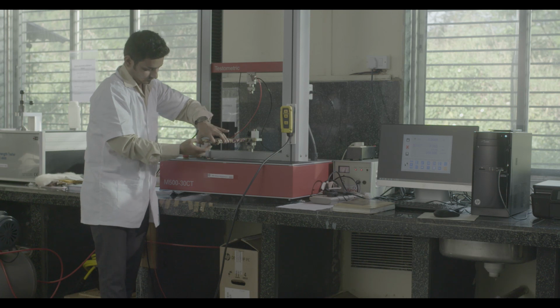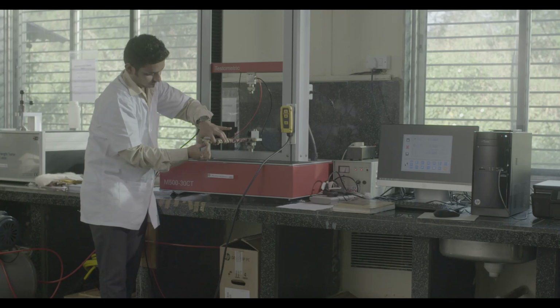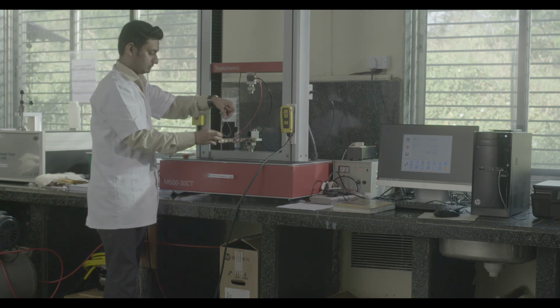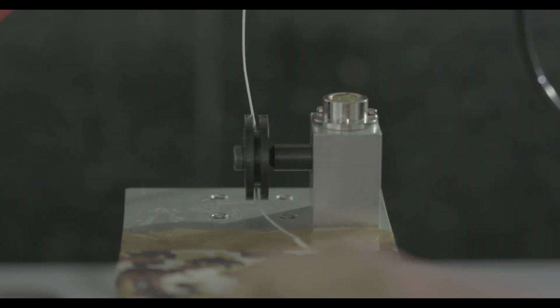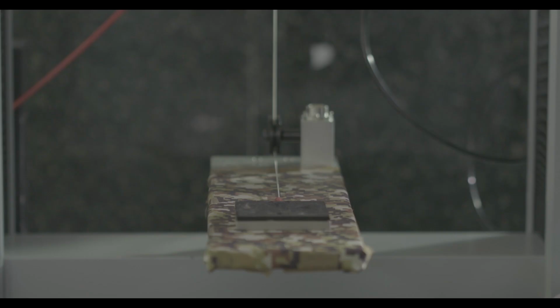Attach the face side of the specimen on the slide by means of an adhesive tape, preventing the tape from covering the testing surface area. Care should be taken not to allow any creases. Then place the sled on the fabric specimen that is on the slide. Attach one end of the standard validated string thread to the sled and the other end to the upper movable jaw of the instrument. For this fabric to metal friction testing, the sled is left without sample attachment so that the metal surface of the sled touches the fabric surface.